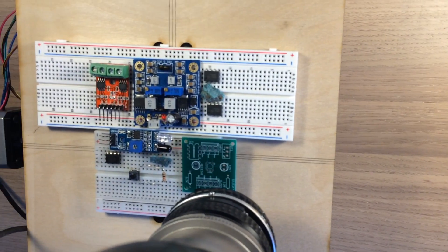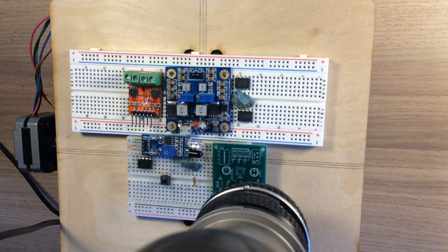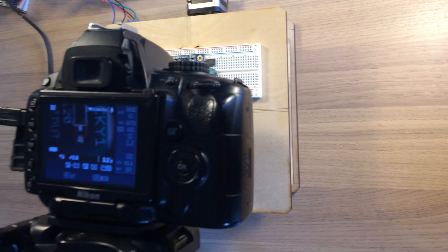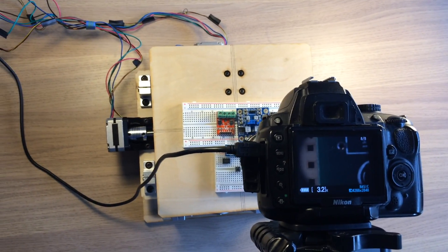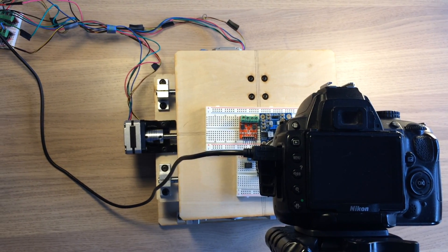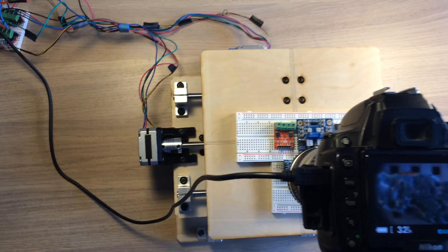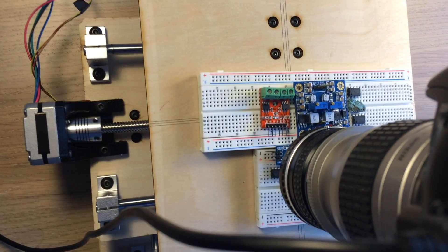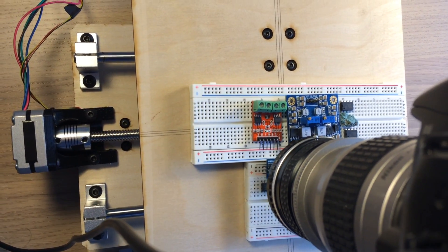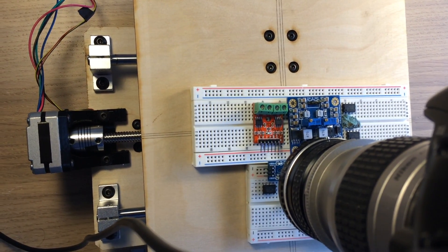In the beginning of the video you can see the stage being zeroed. IR sensors on both axes are used to determine the range of motion allowed by the stepper motors. The camera is then aligned with the stage and a push button starts the acquisition. The system then raster scans through the sample so there is a little overlap between the images. The overlap is then used to align the images when stitching them together.